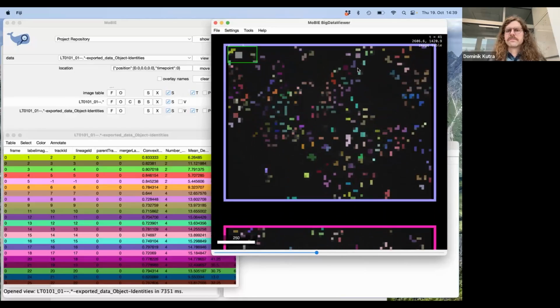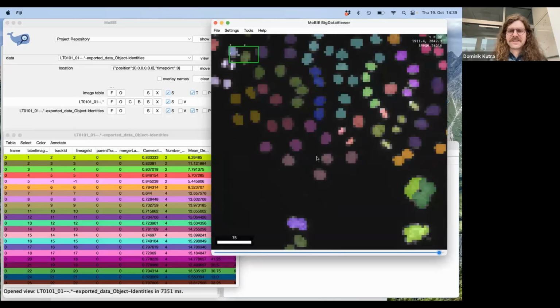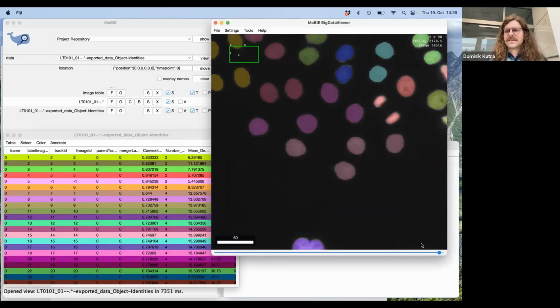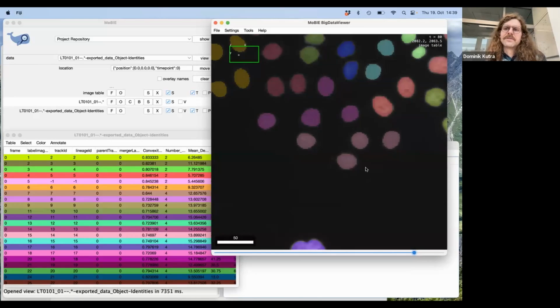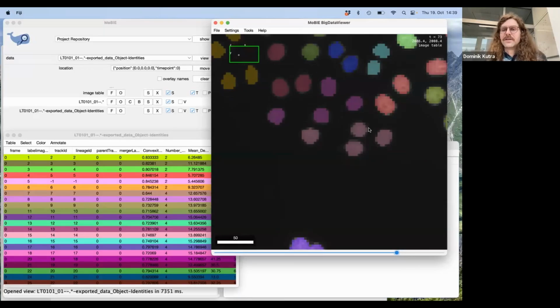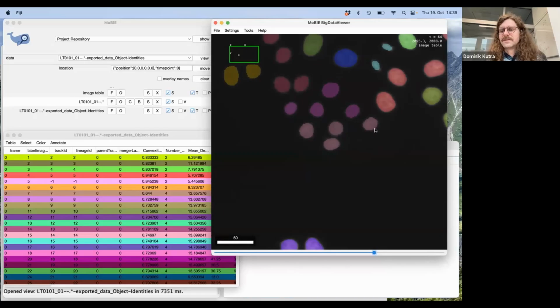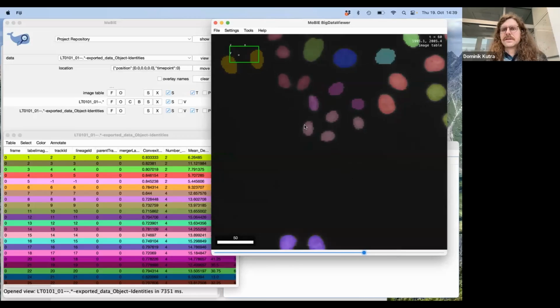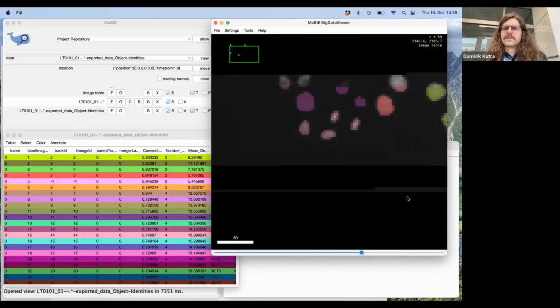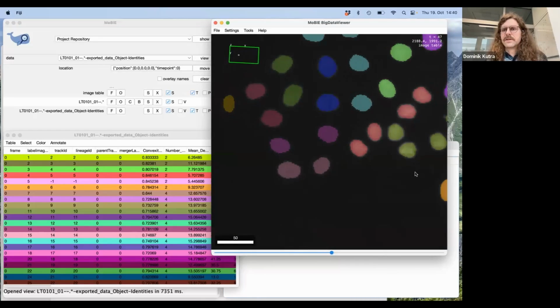And then the idea would be more or less like before, you go to an image. For me, the easiest is to go backwards in tracking, right? So I zoom in somewhere. And then in principle, I would go backwards and see, okay, does it look good? I mean, here we would expect that all cells that divide, or now go back together since we are going backwards, should have the same color. So do we see an event like this here, for example? Here is a division. That looks correct. Then here, also a division that looks correct. And it actually looks quite good for this particular data set.